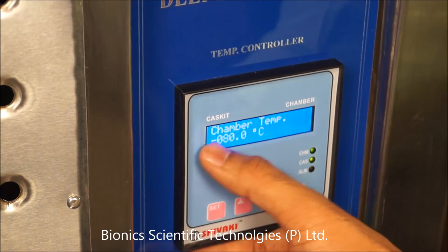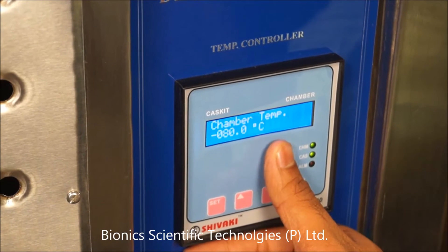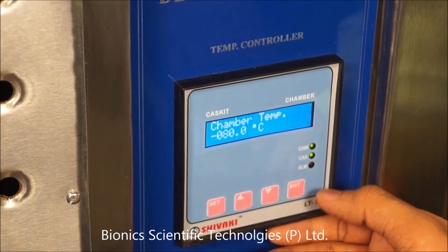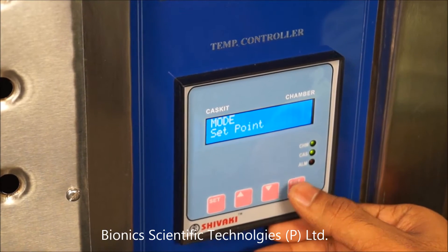So I have decided that I will set the temperature to minus 80 degrees Celsius. And now I will press enter. Now it is set.